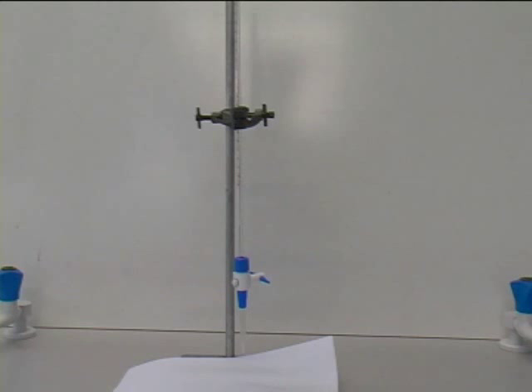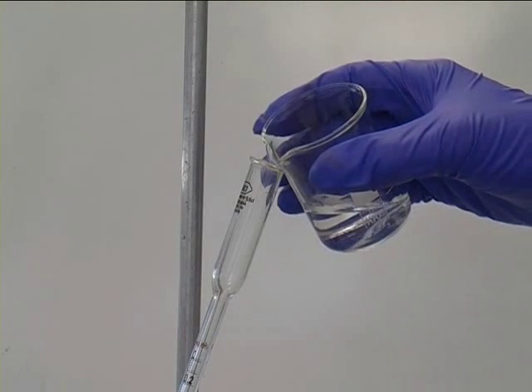This is a burette. Notice how it is clamped and there is a white piece of paper underneath it so you can see where the end point is.